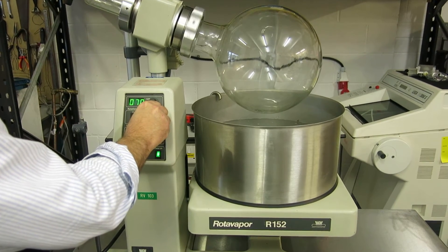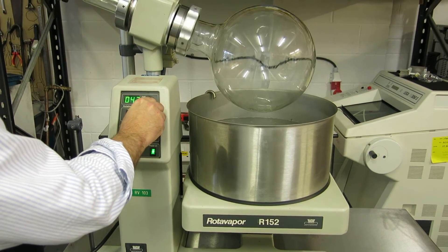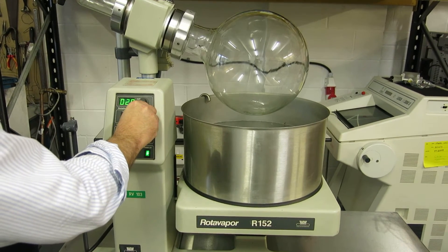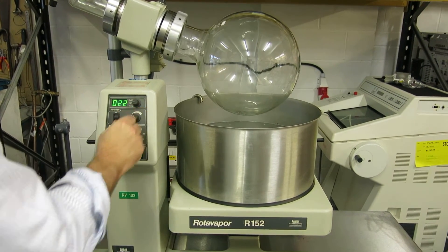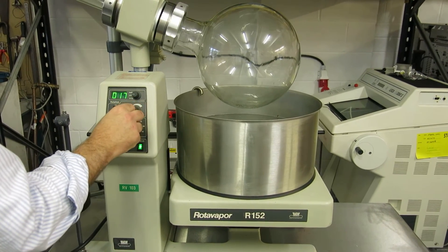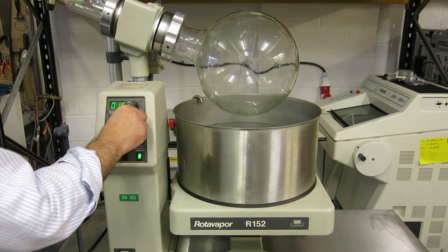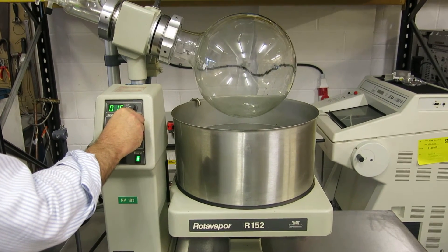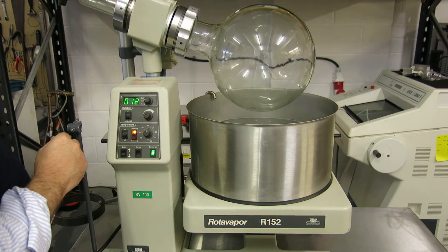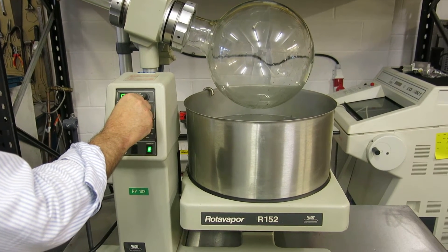And down to pretty slow — 46. We'll let it catch up. It's very slow here: 25. Let's take it down further — this is about 16. So that's about the maximum slowest that it goes, pretty much.